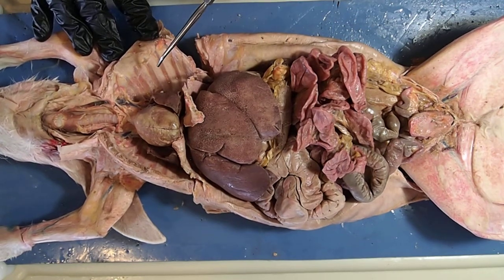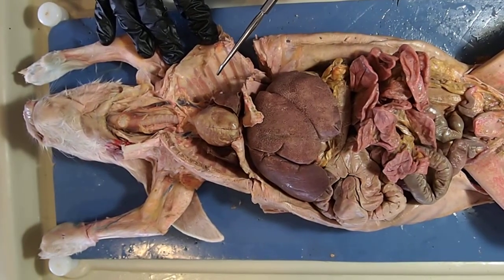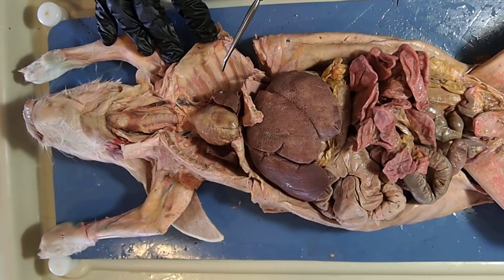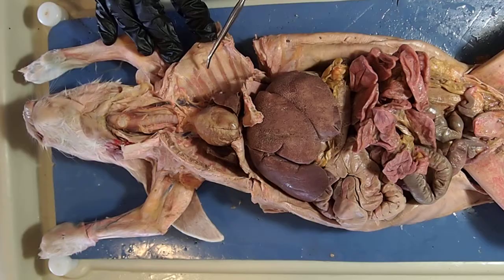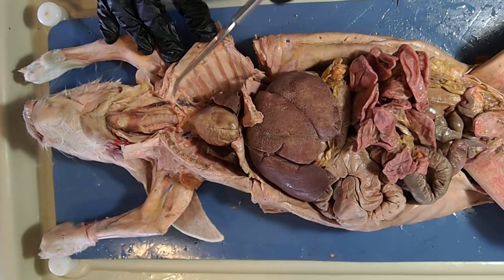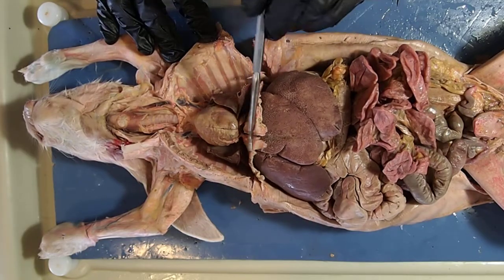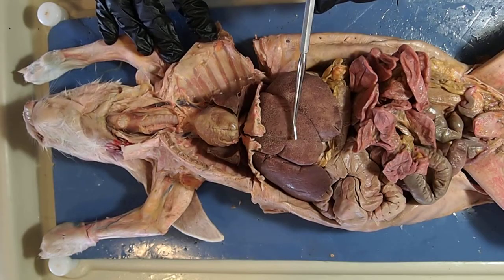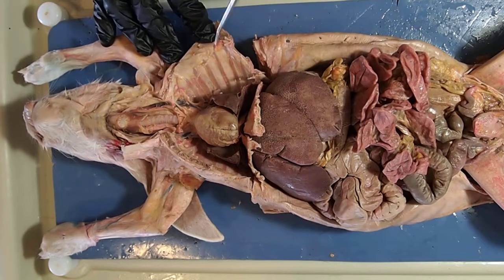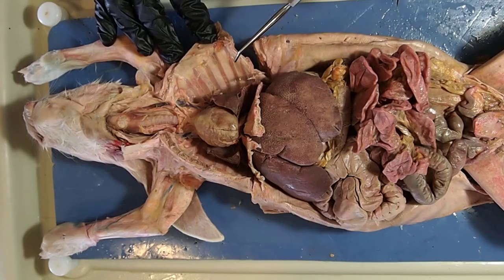Good afternoon from my home studio slash biology lab slash craft room. Today we're going to be looking at the internal organs, starting with the thoracic organs first. The thoracic cavity is divided by the diaphragm, and once we pass it we enter the abdominal cavity. We'll look at the thoracic organs first and then move on down to the digestive organs.